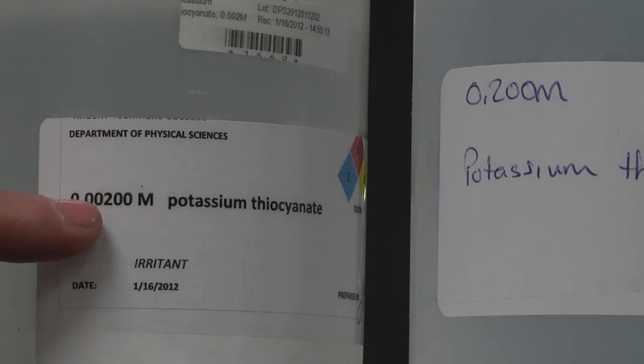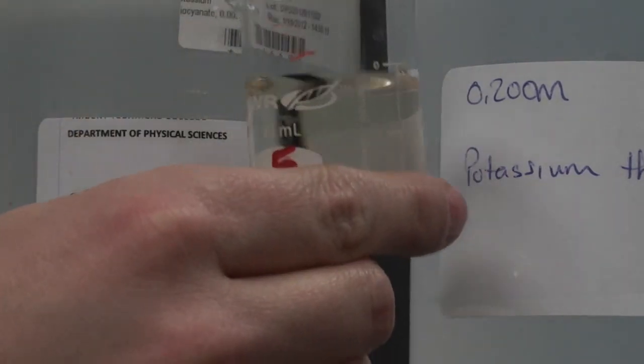If your beaker number one looks like a pale, pale, pale, pale, pale yellow, you used the wrong molarity.